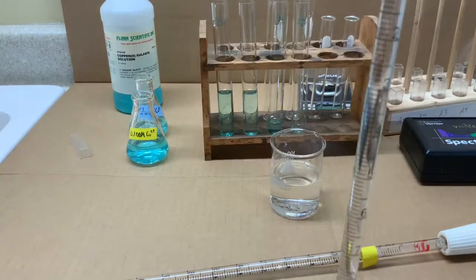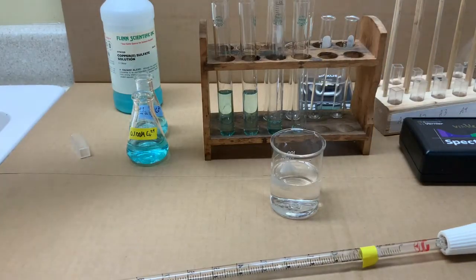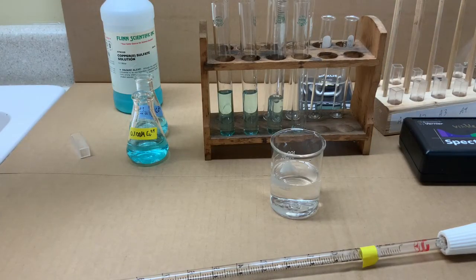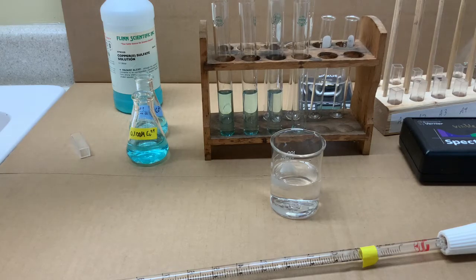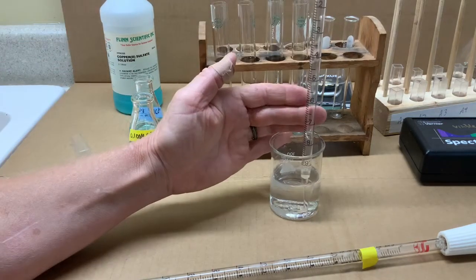And next, solution 4, we need 7 milliliters of water, so it's drawn up to the 3, making a total of 10 milliliters of solution.